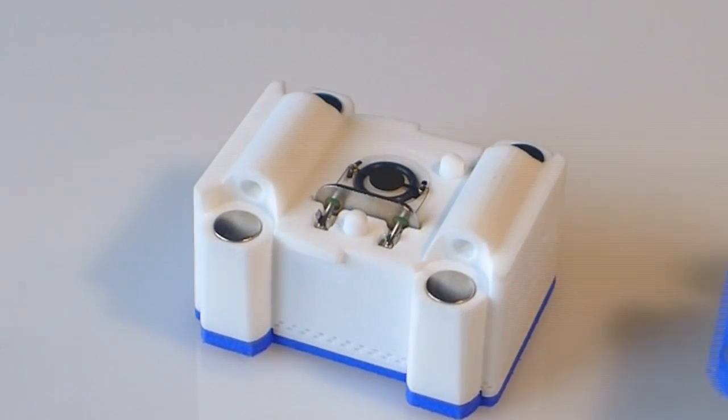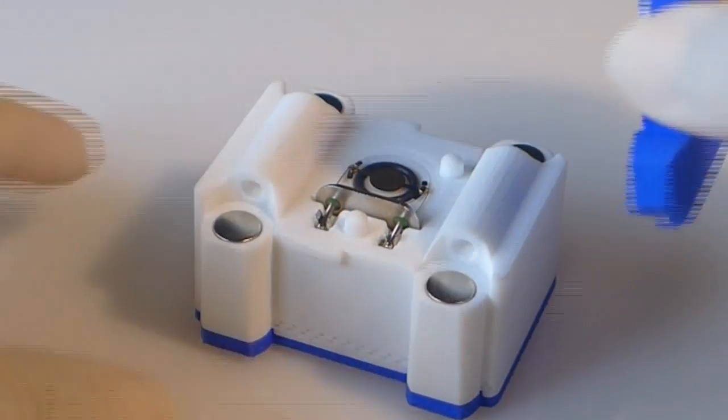Connect the holder to the clip on the base unit. The holder can be mounted either way up.